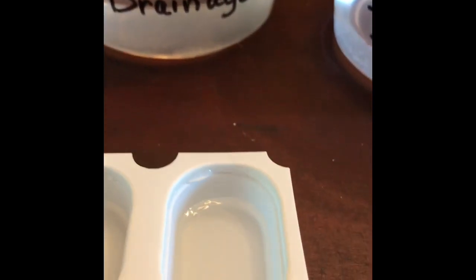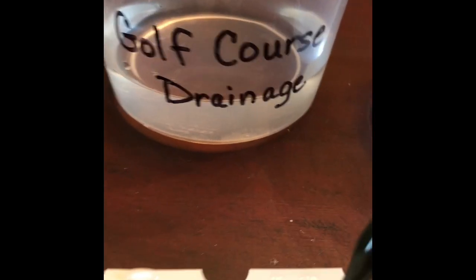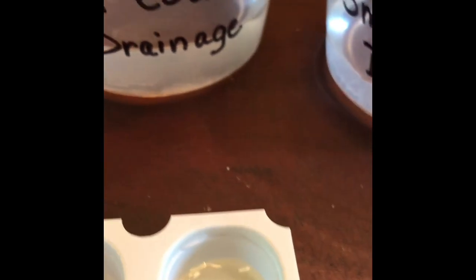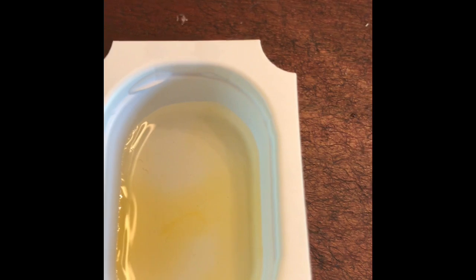Now to test the golf course drainage. So I've already put a sample of the golf course drainage in our little boat. And again, I'm going to just add a few drops of our phosphate indicator. About 5 drops. So if you can note the color, and you're going to record that in your data sheet for the golf course drainage. Remember, yellow is too high of phosphate levels in the water, and blue or green is an okay level of phosphates in the water for fish to live.